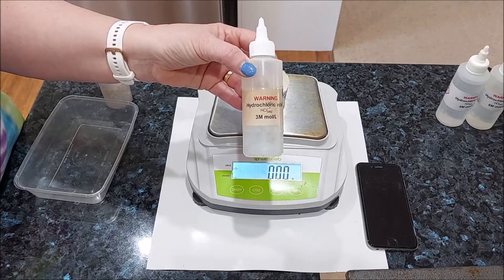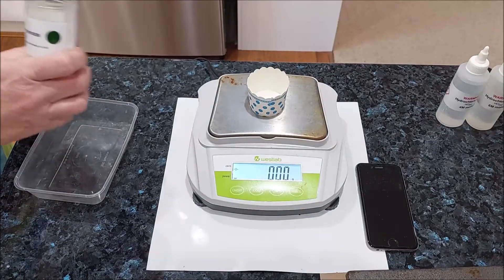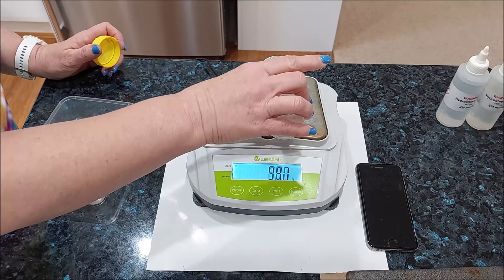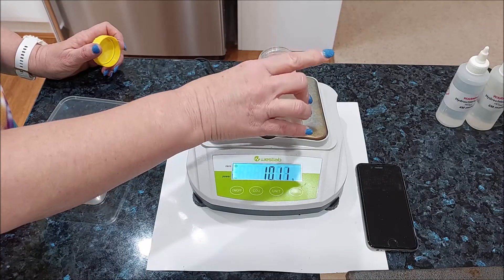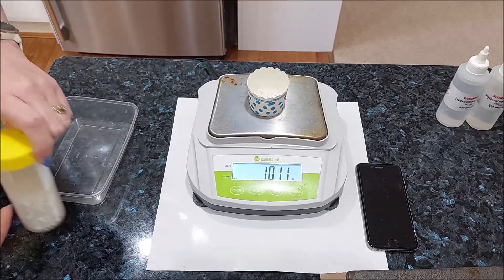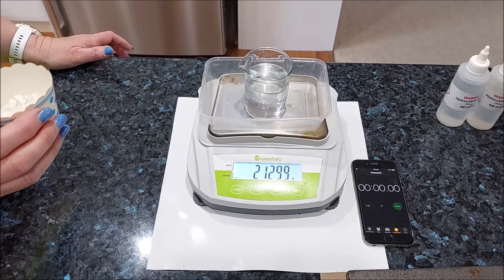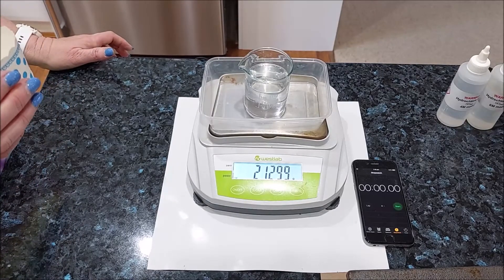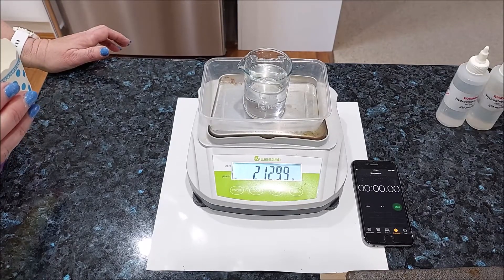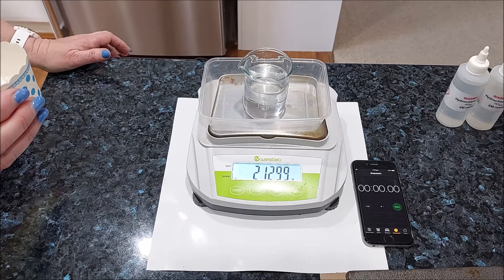This time we're going to use 3 moles per liter hydrochloric acid and we're going to weigh our 10 grams of marble chips. So remember, we're going to add 10.11 grams to our starting mass. Here we go — 3 mole per liter acid with 10.11 grams of marble chips. Remember to add that to our starting mass. I've put the beaker inside a plastic container just in case the reaction is a little fast this time.